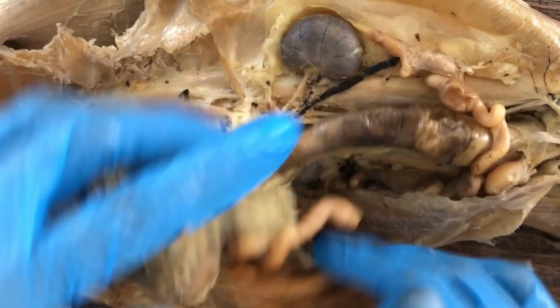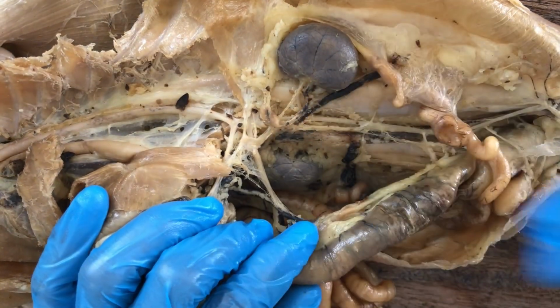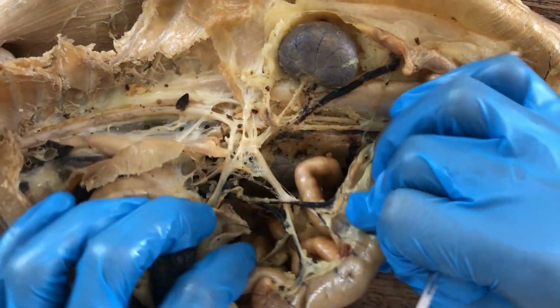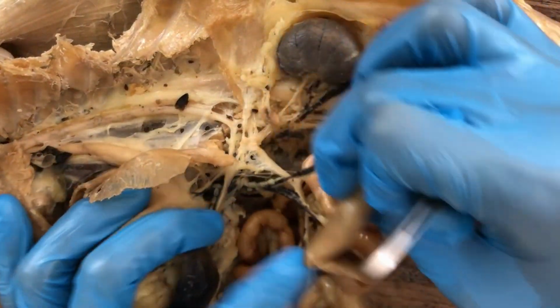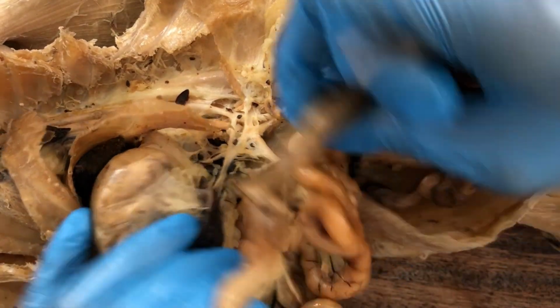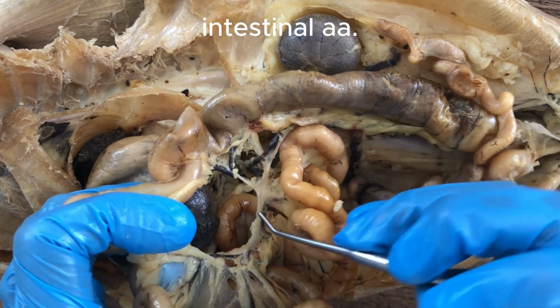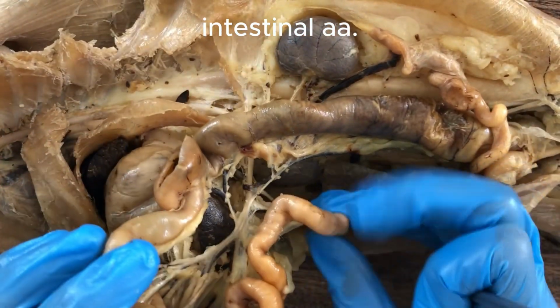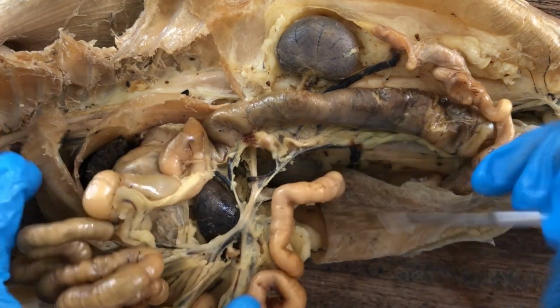All right. And then next we examine the branches of the superior mesenteric artery. The superior mesenteric artery gives rise to the intestinal arteries here, going to the jejunum and also the ileum. Those would be the intestinal arteries coming from the superior mesenteric.